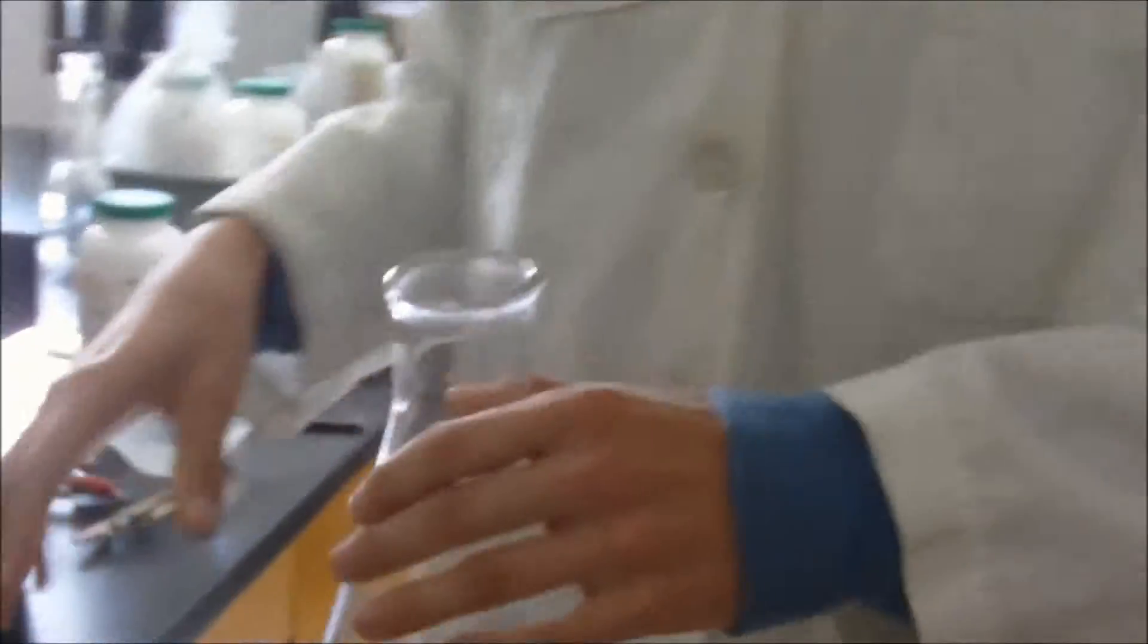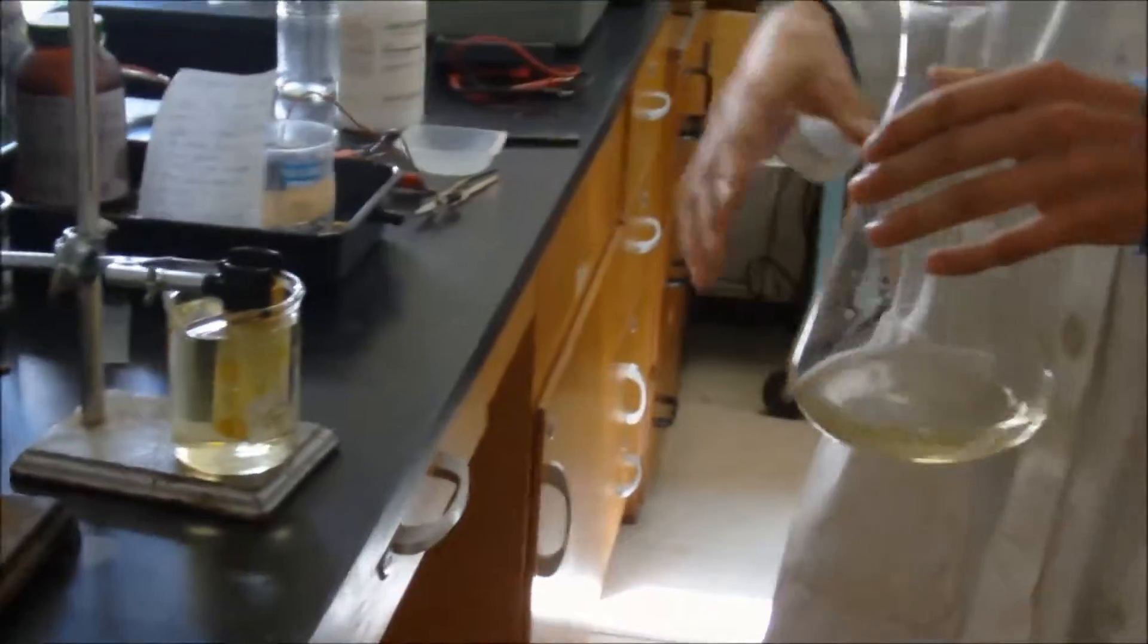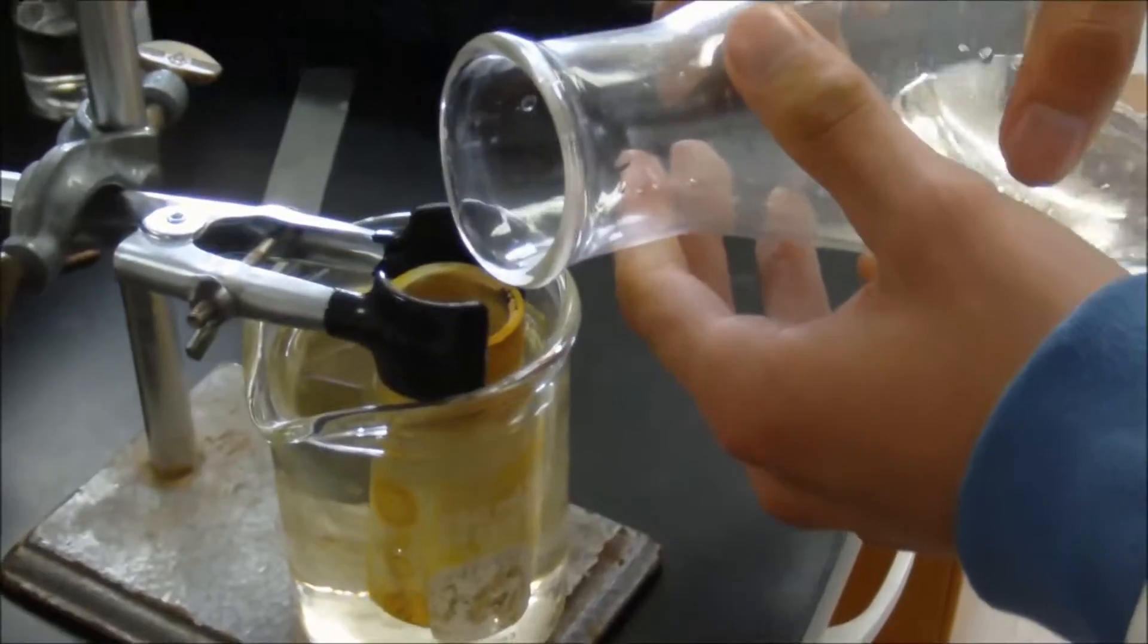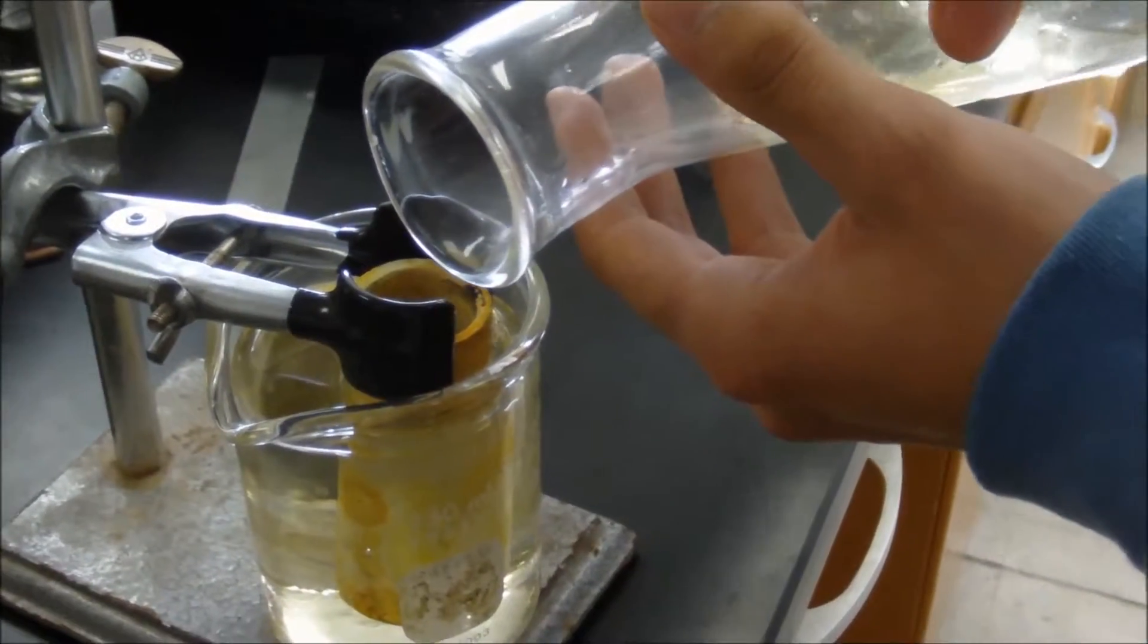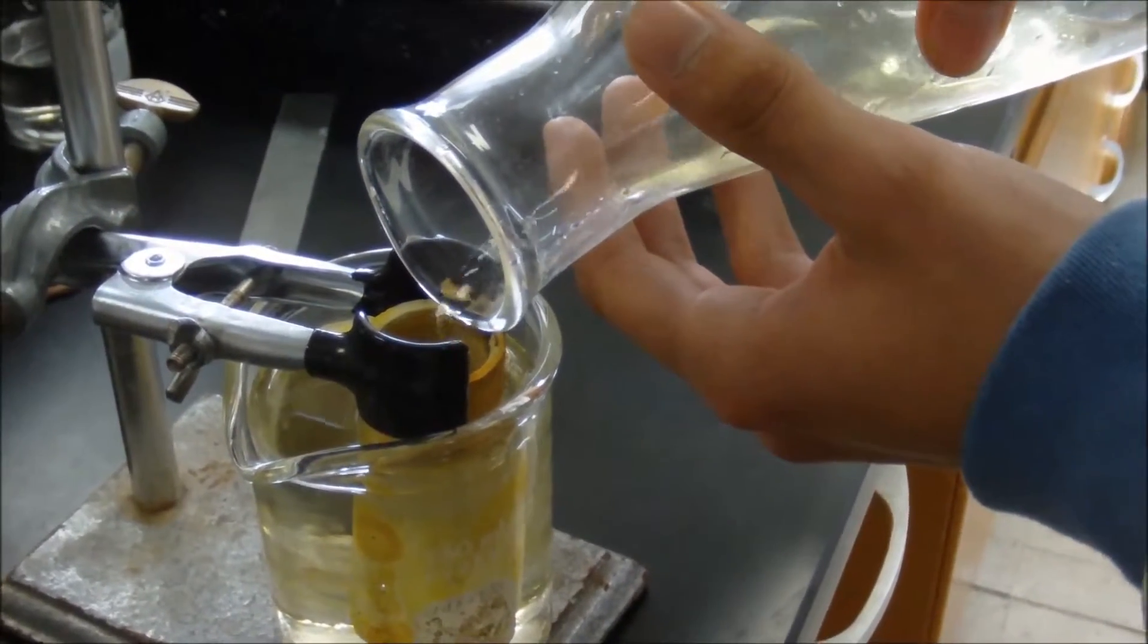Then I'm going to fill the inside of the porous cup to the same water level as is in the beaker. Carefully. There we go.